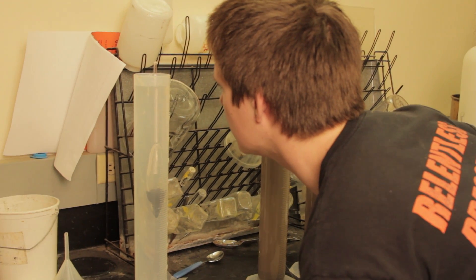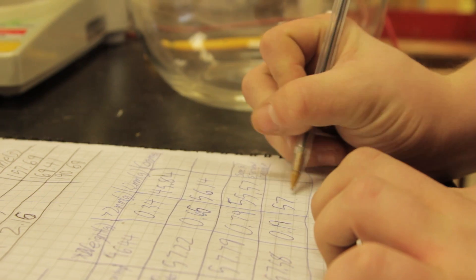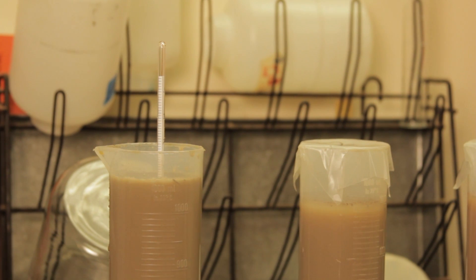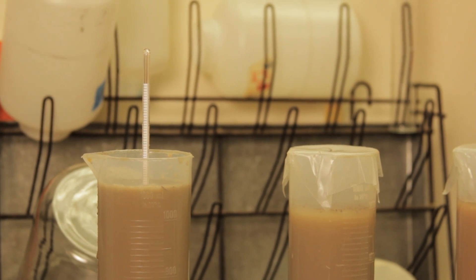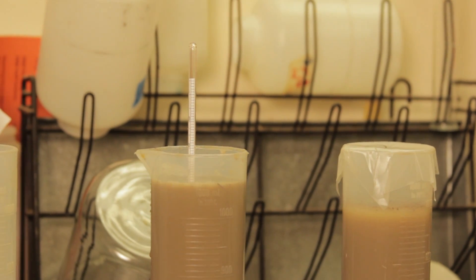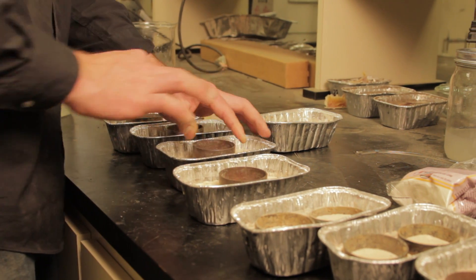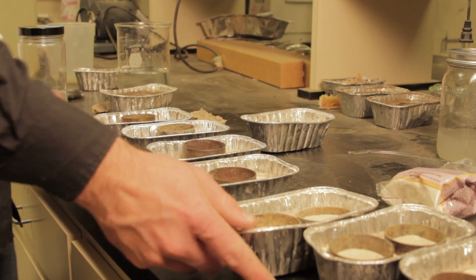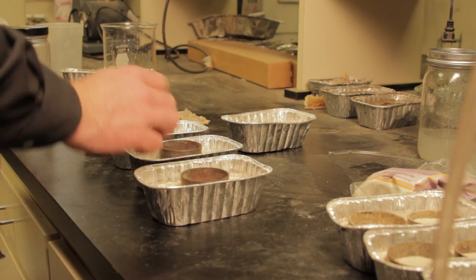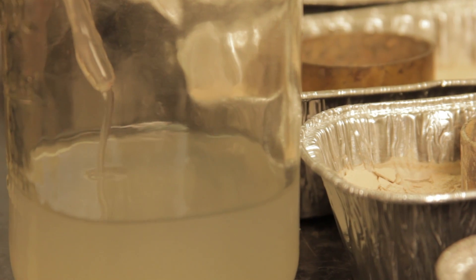We use a hydrometer — a glass instrument, basically the same thing people use for brewing beer or making wine — to determine the density of the fluid. We're also using a food thickener called guar gum, which thickens water in a predictable manner to make it more viscous.